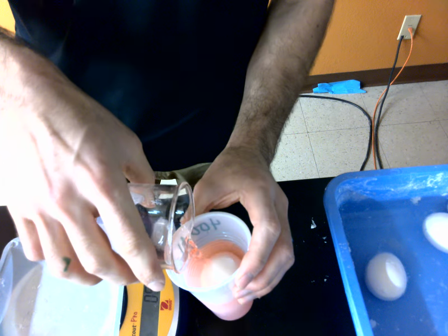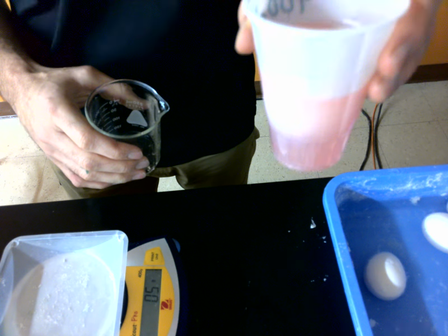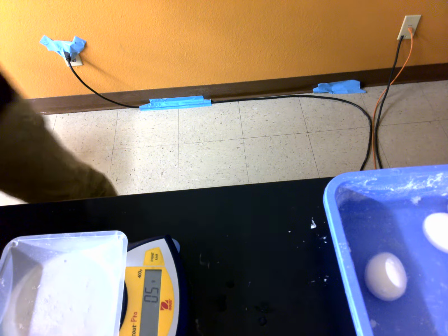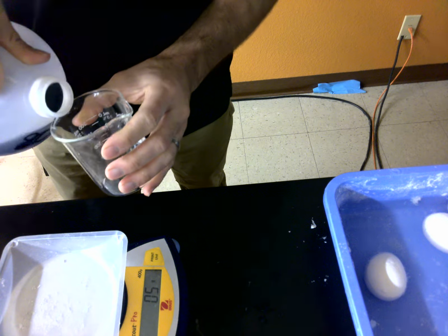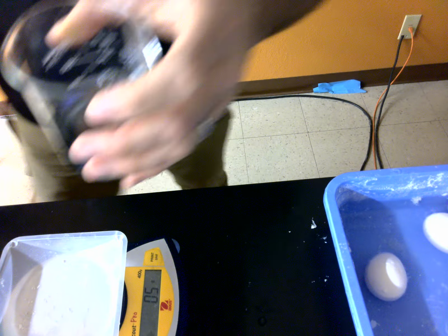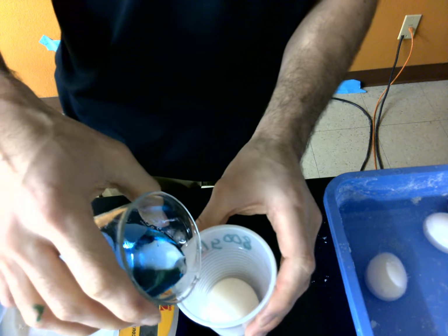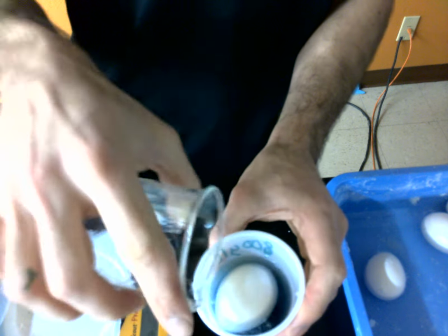And so you'll notice that the last two are actually floating. Okay, I don't know if you can tell. And that should make sense to you because if you've ever floated in salt water in the ocean versus floating in like a lake, you'll notice that the salt helps you float quite a bit. And so just like the salt is a solute dissolved in the water of the ocean, the sugar is a solute dissolved in this water, and it is going to make the egg kind of floaty. See as it floats up right there.